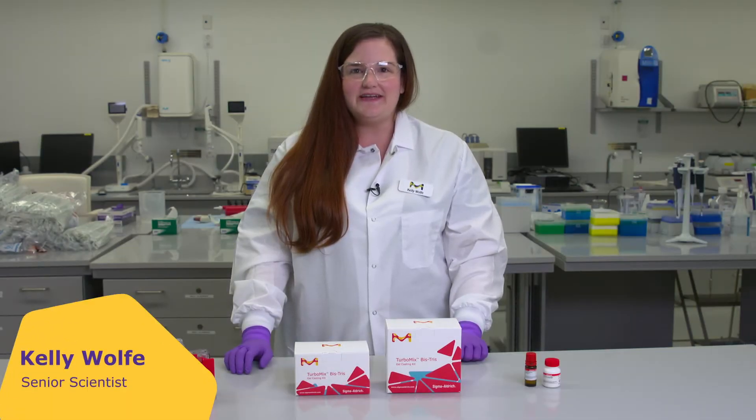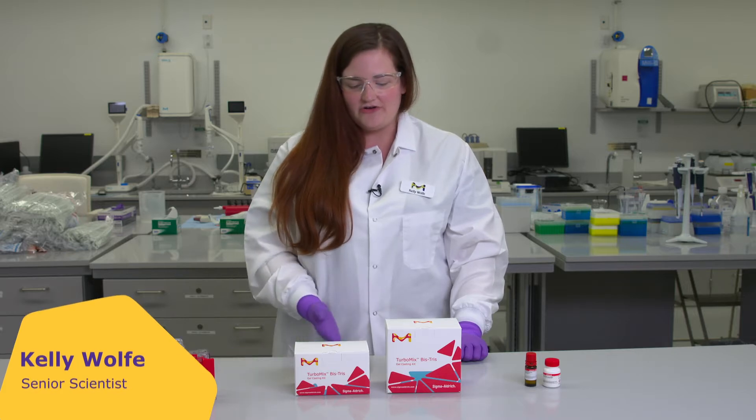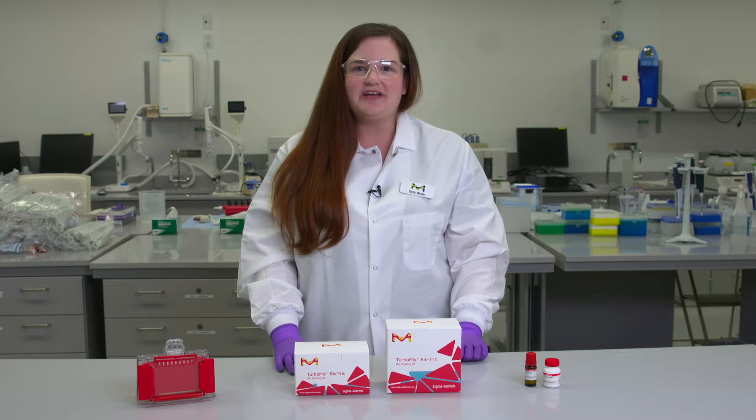Hi, I'm Kelly Wolf and today I'll show you how to cast your own polyacrylamide gel using our new TurboMix BisTris Gel Casting Kit.